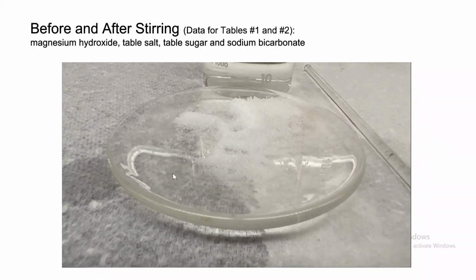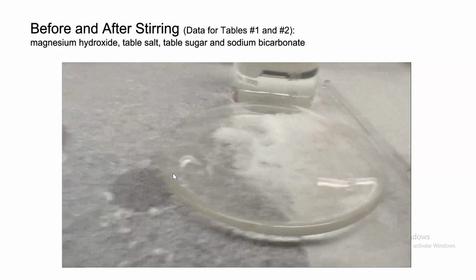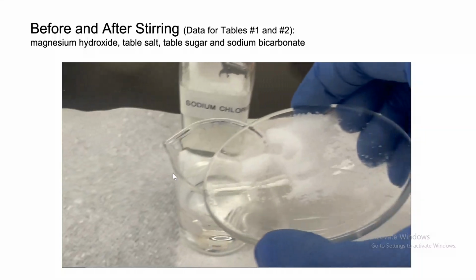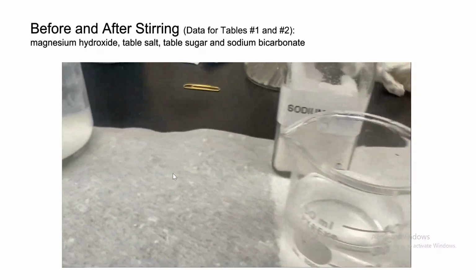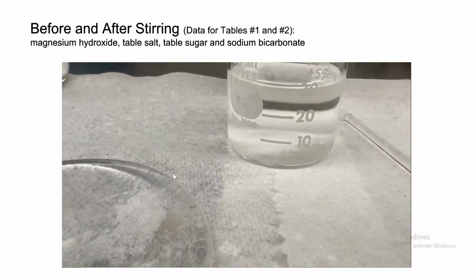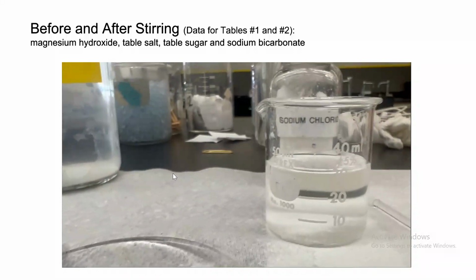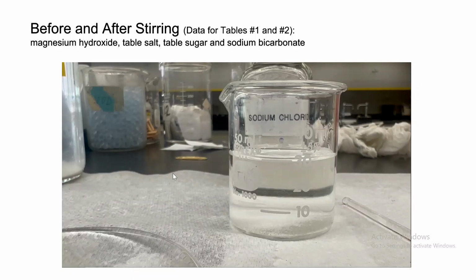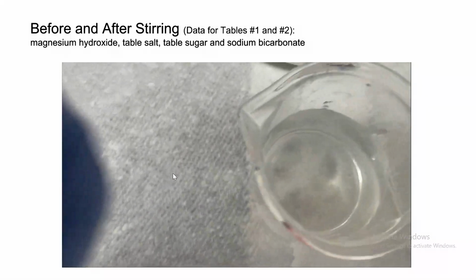Here it is. That's salt. We're gonna take salt and add it to water. Notice we are adding it. Notice, does it float or does it sink? It does sink. Look, the salt is all the way at the bottom. So you're gonna write sinks and more dense for table 1. Now what we're gonna do is stir it.